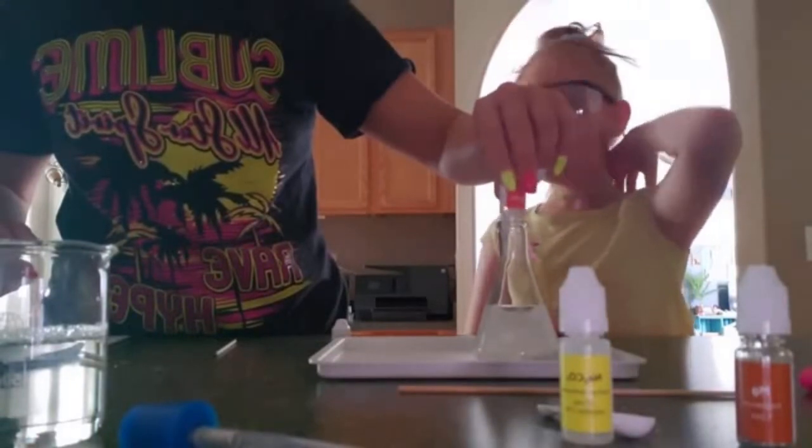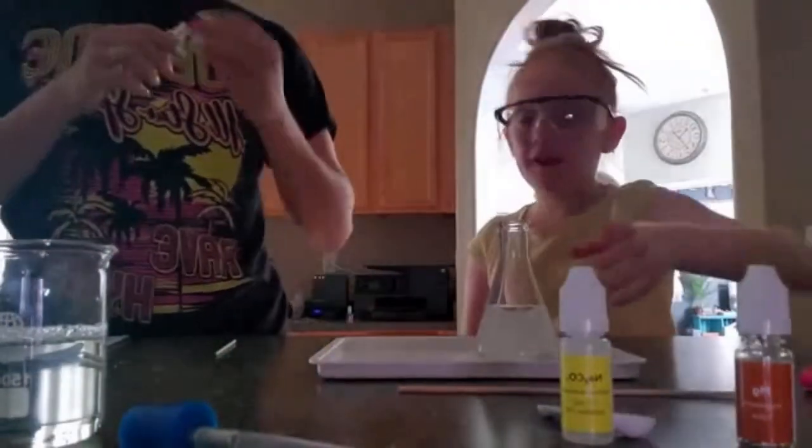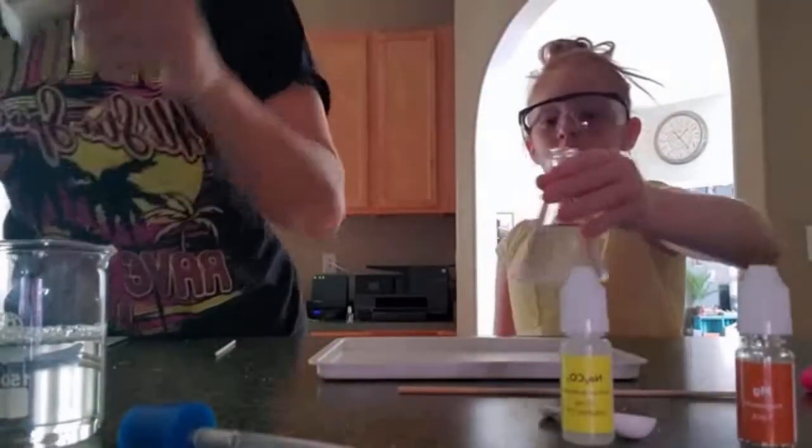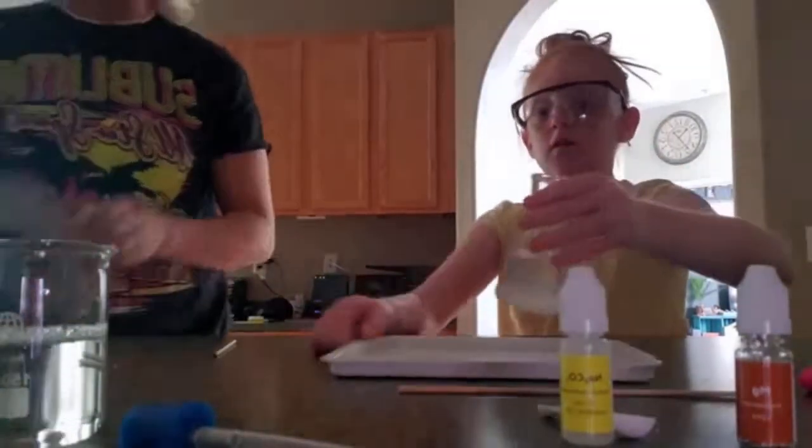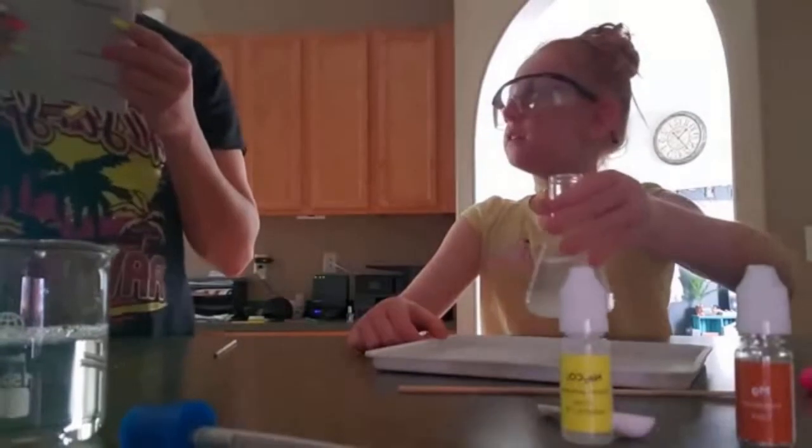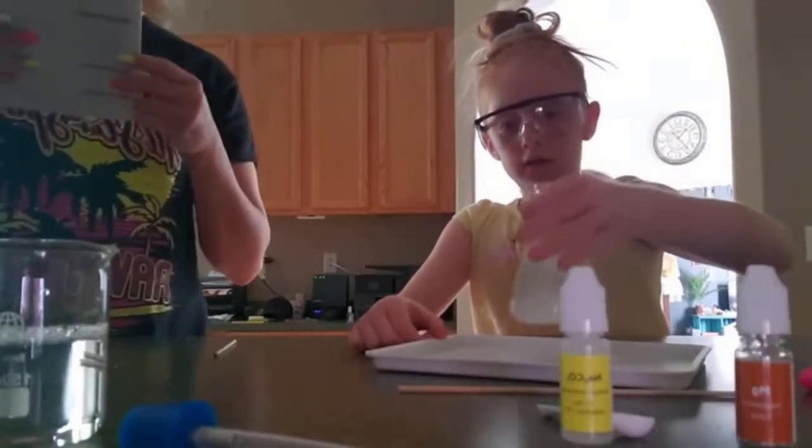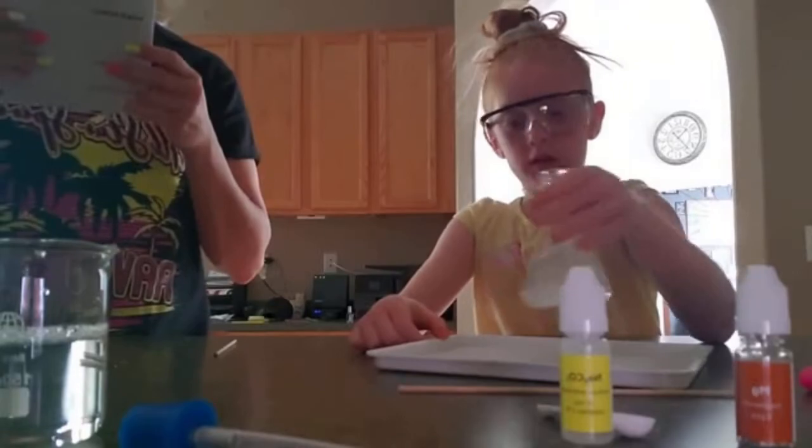All right, swirl away for one minute. Count to 60 quietly in your head. Keep counting to 60.